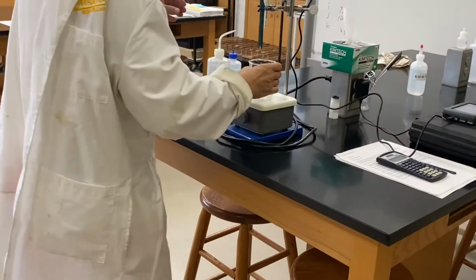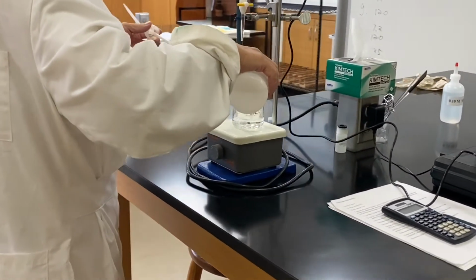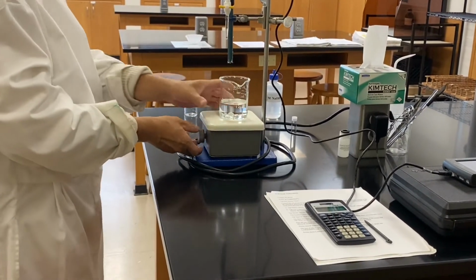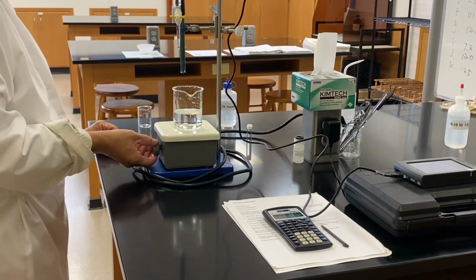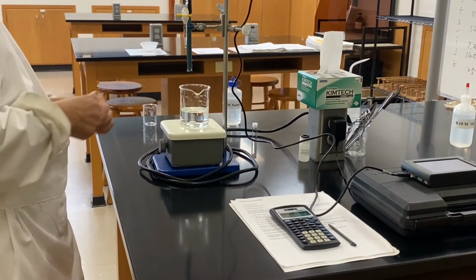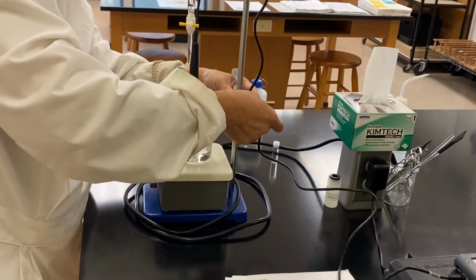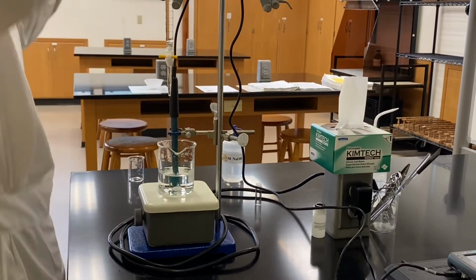Now, we do exactly the same, about 100 milliliter water. So just enough to have our whirlpool. Right? All right, now the whirlpool starts up, and then we're going to turn it slowly but surely, and then lower our pH meter into the system. Okay, very well.